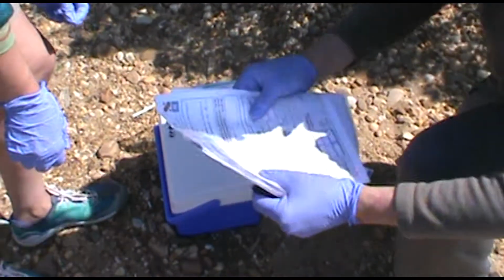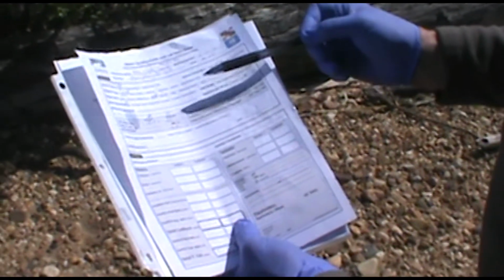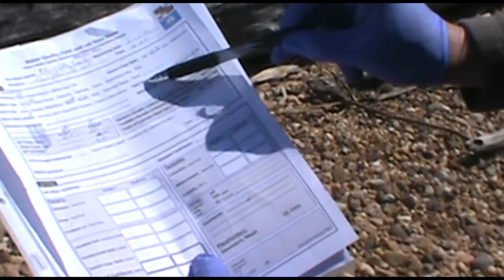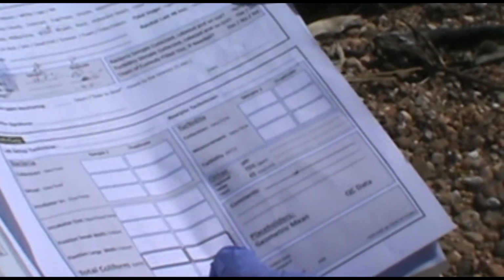Maybe carry the rest of this. We'll just go over the list, make sure we got everything that we did. We did field observation. We checked the water surface, what the weather was like, the color of the water. We looked at stream flow rate. The tidal stage is low but incoming as best we can tell. There hasn't been any rainfall in the last 2 days. I checked that at National Airport's weather station before we went out, so it's the same for all the different collections we do today. We did the air temperature and the water temperature.